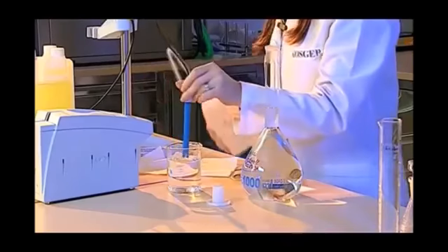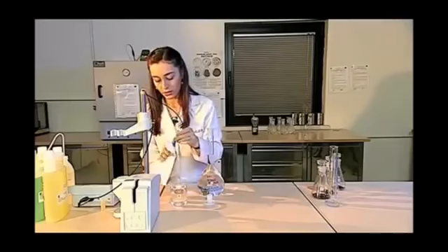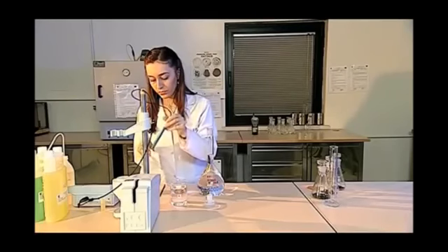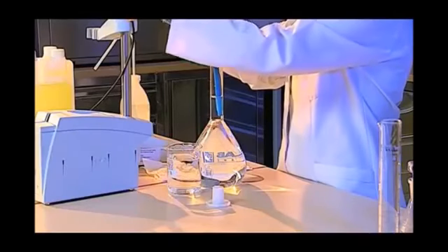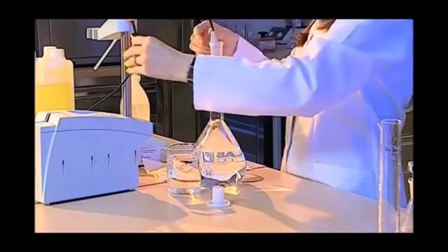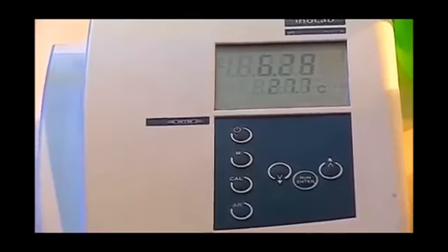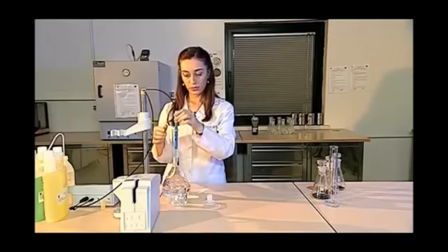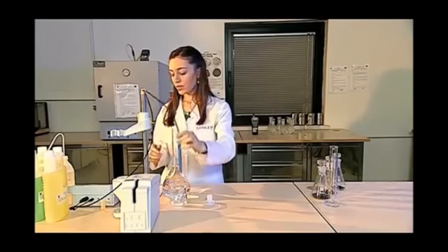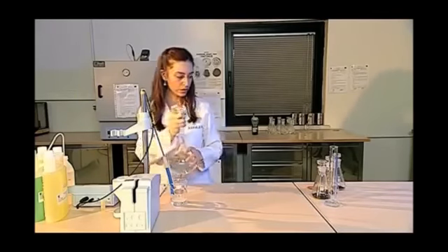Now I measure the pH of the solution. Again, I wash and dry the electrode with pure water and immediately dip it into the solution. I set the length here and wait for the fixation of the value on the screen. I save the pH value when I am sure that it is fixed. I can also see the temperature of the solution on the screen of the pH meter, and I save both the temperature and the pH value.